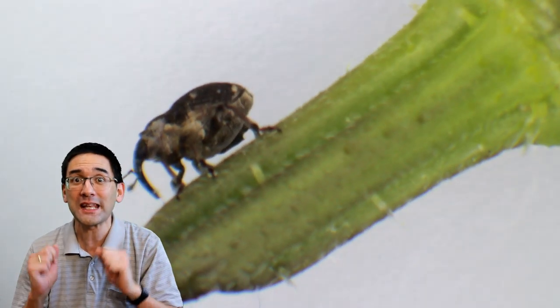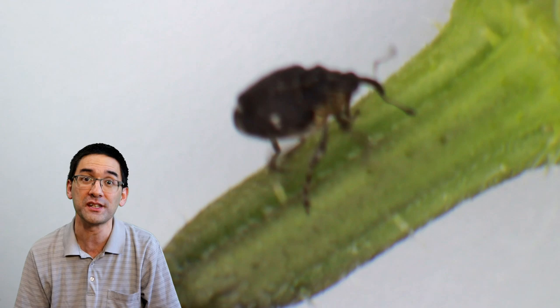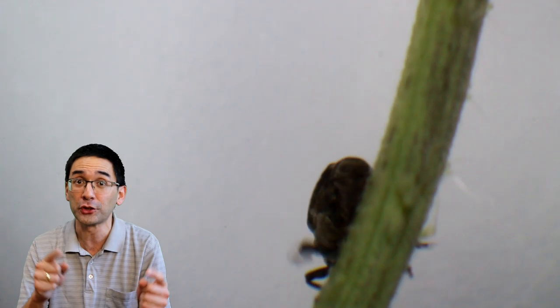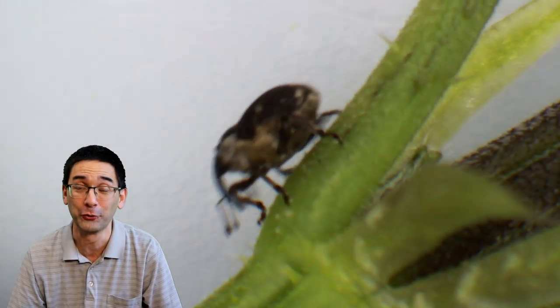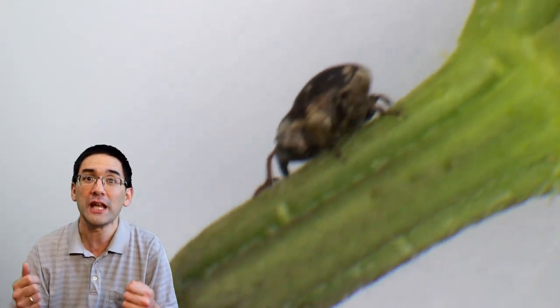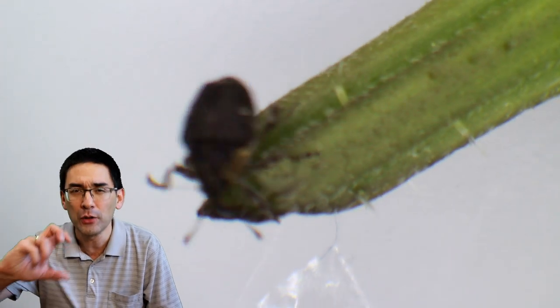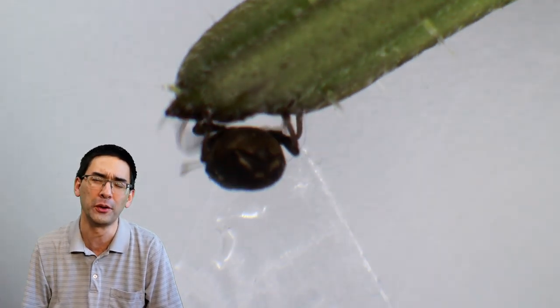Insects can be a little bit difficult to observe under the stereo microscope because they're pretty restless. Many of them move around, they crawl around, some of them fly away, and it's difficult to chase them under the microscope while at the same time operating the focusing knob.